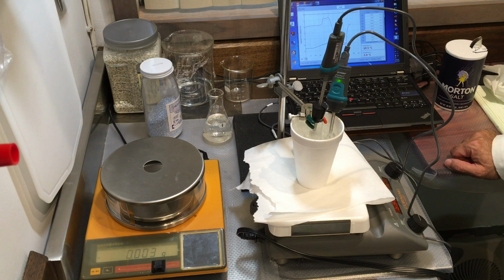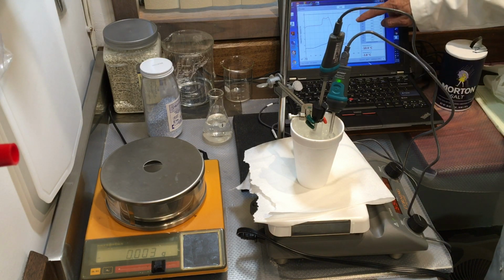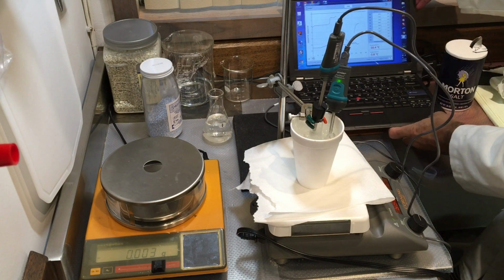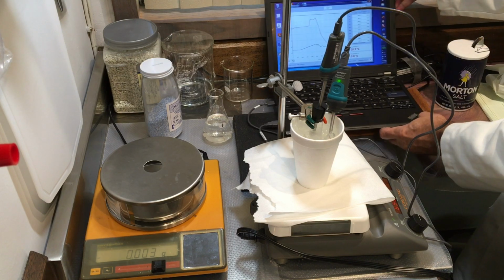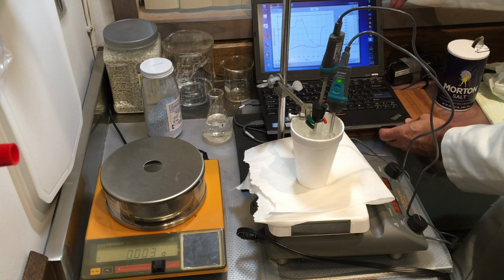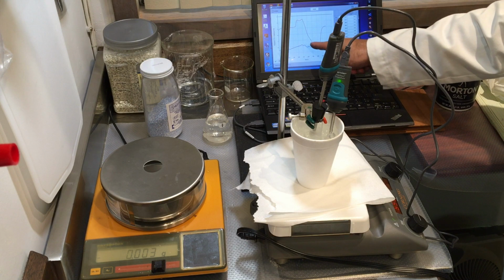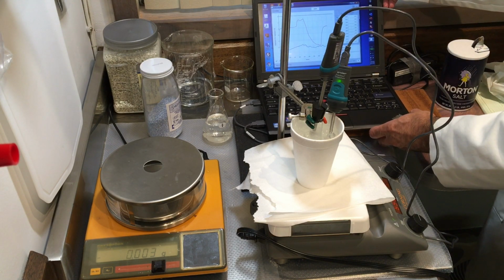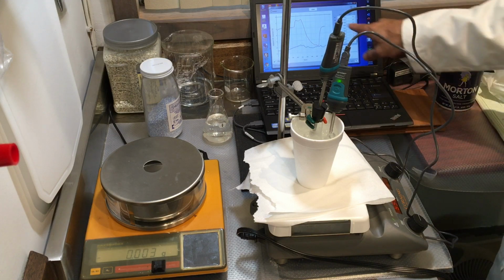But it is going to become constant. So this is the nucleation process. It's right by the thermometer. Let's put it here. Okay, now I have a better view. This is where the nucleation took place, right down here. And now the temperature of freezing is stabilizing right here.